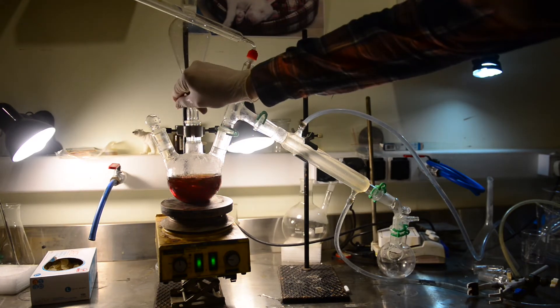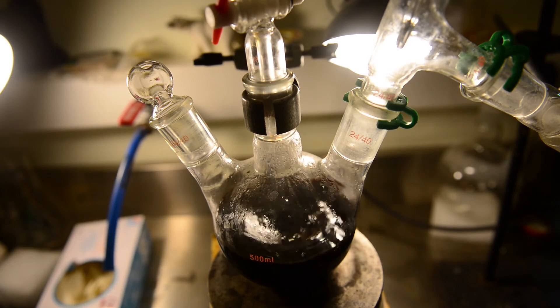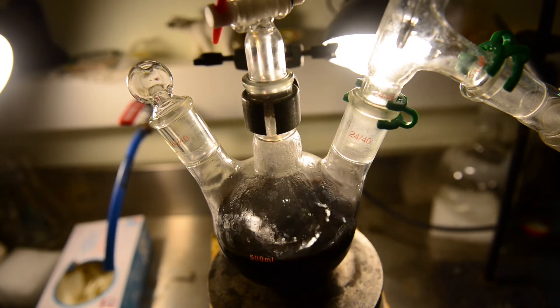Here is when the problems began. The liquid was changed in coloration from red and to deep brown. In fact, almost got black, the clear signs of bromine formation.